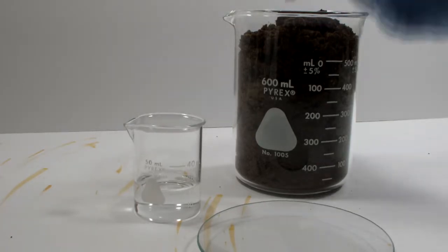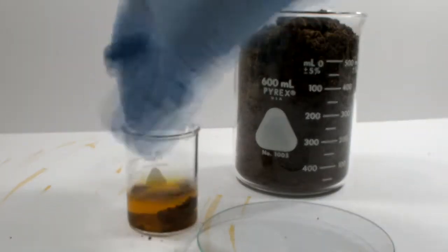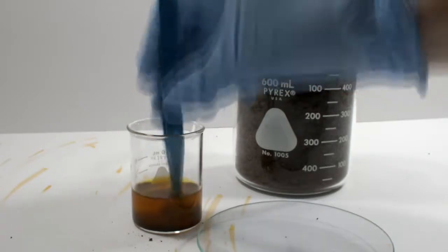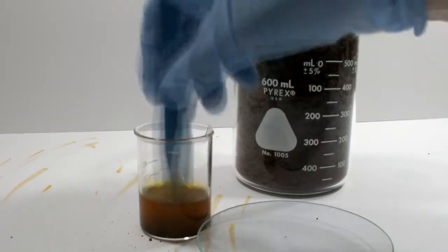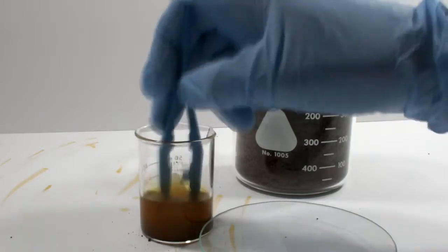The first solvent I'm trying is 100% denatured ethanol. It's much less polar than water, and while iron 2 chloride is still soluble in alcohol, my hope is that it's a bit slower to dissolve. However, I can't even get the gunk off easily enough, so I'm going to try to dilute the alcohol a little bit and try an 80% solution in water.